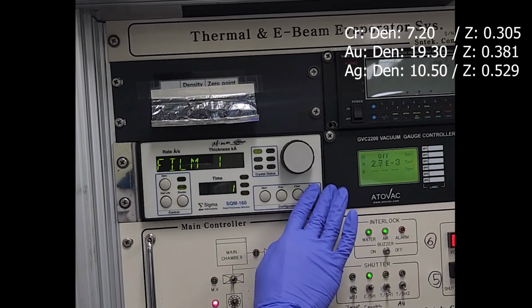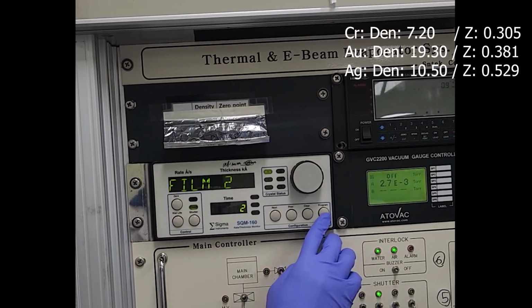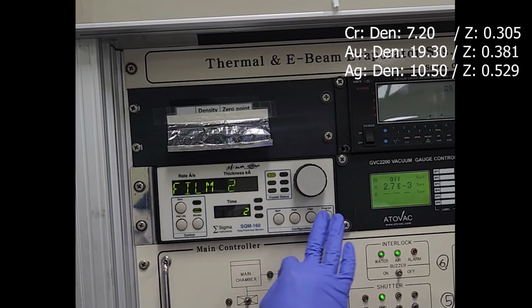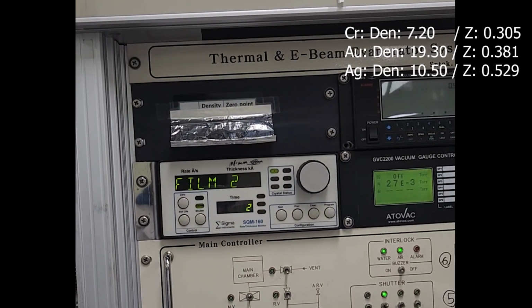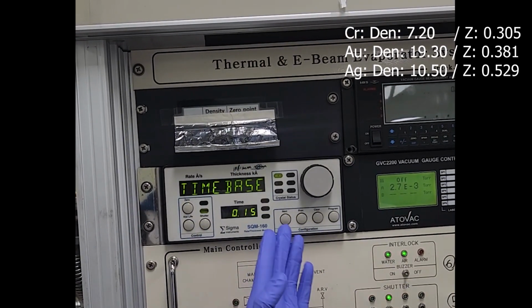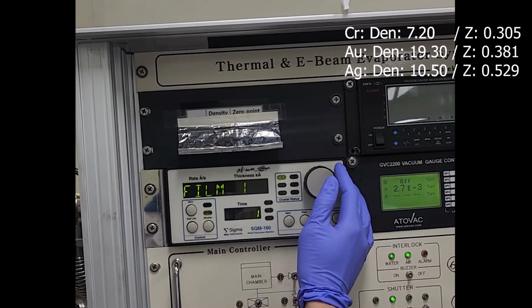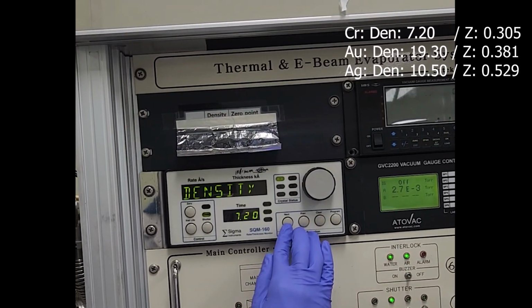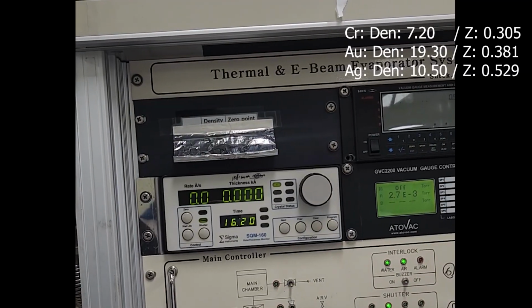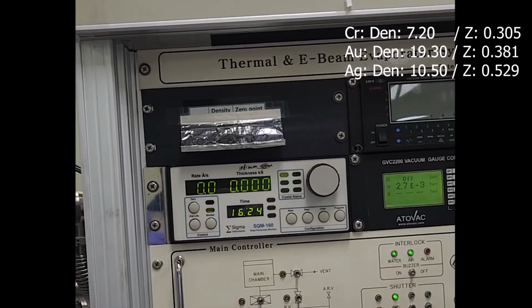So you should check by next and review, and check it one more time. Okay, film 1 done like this.